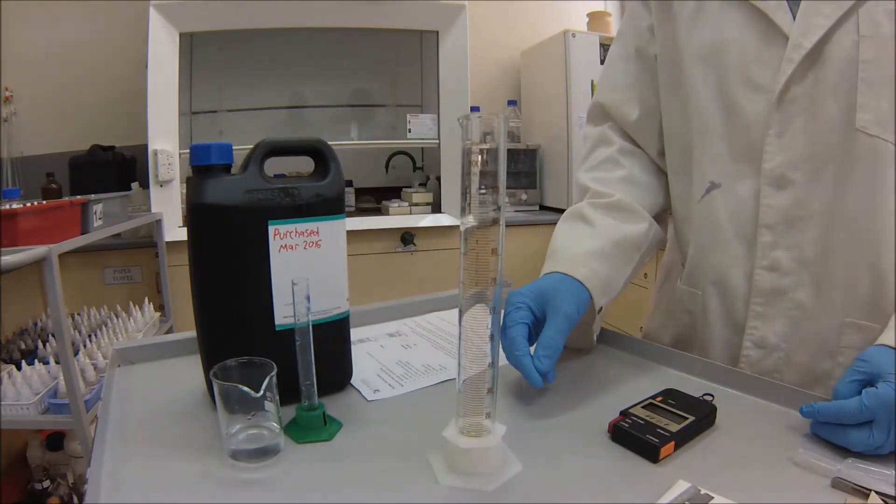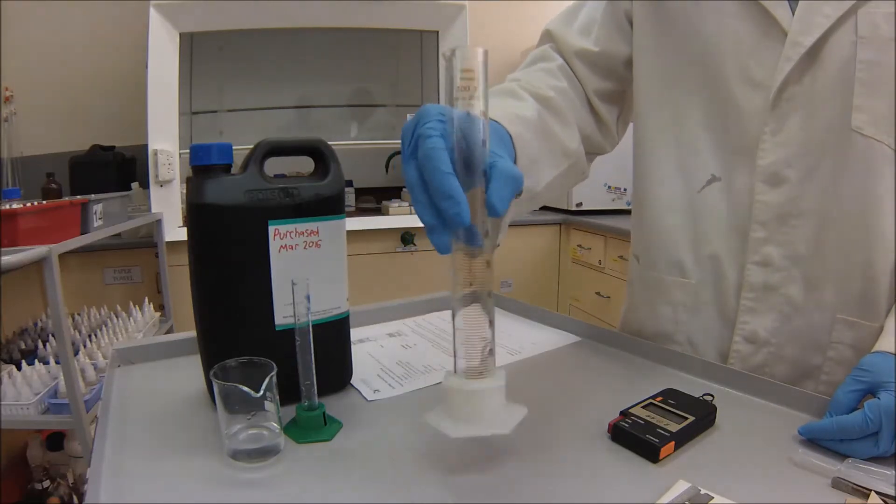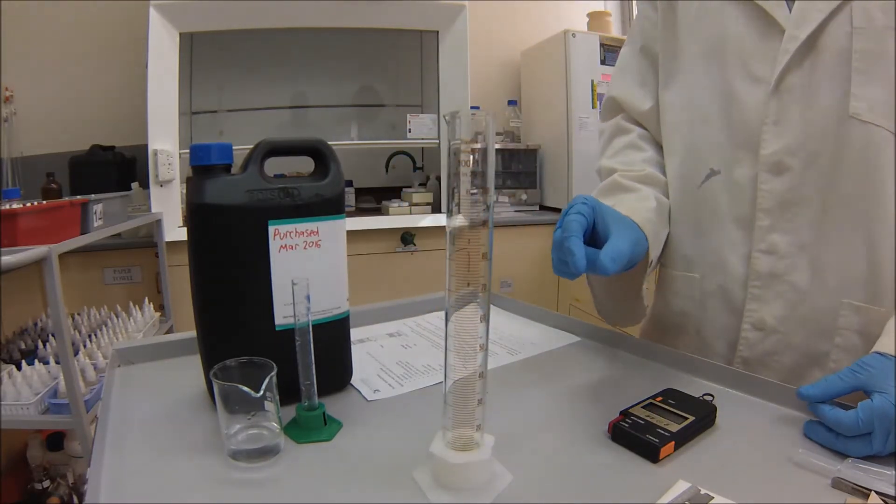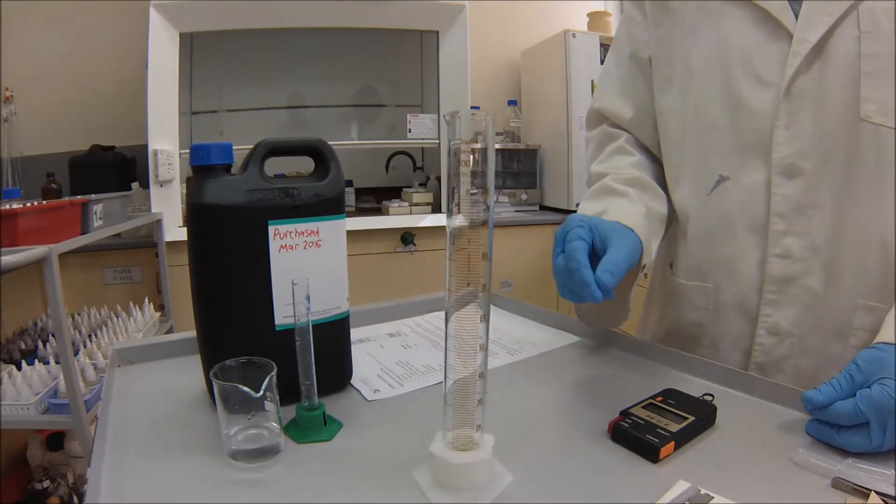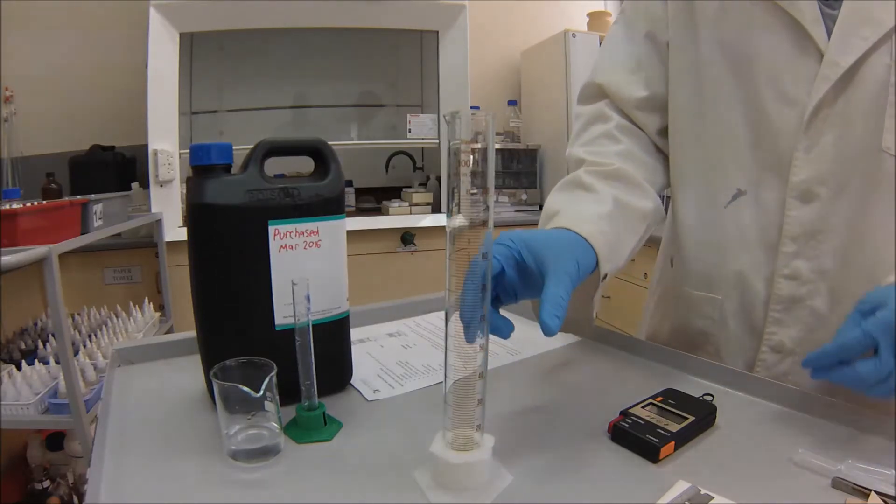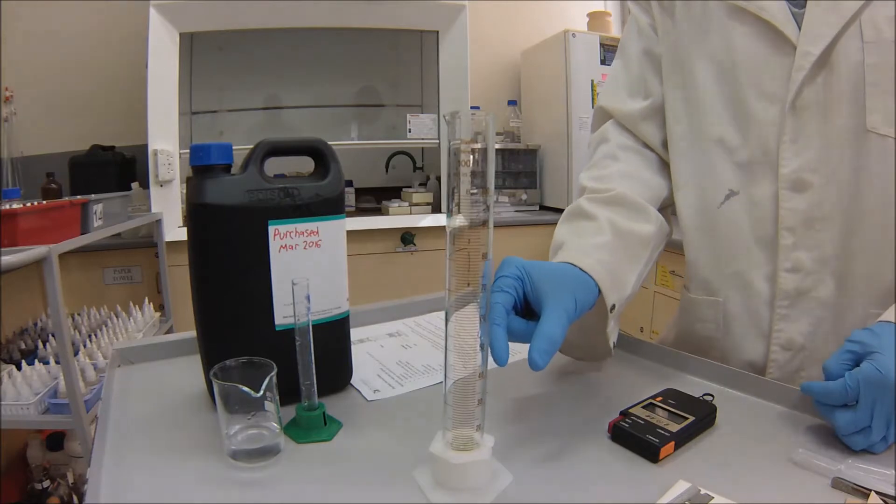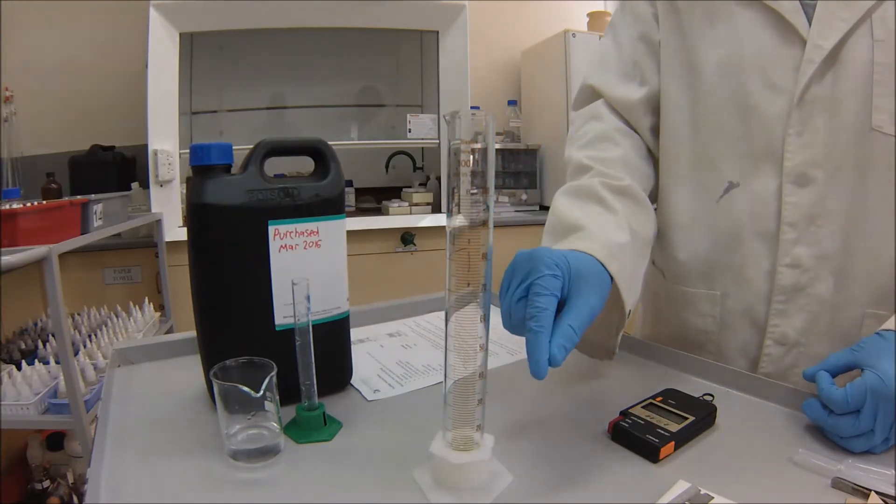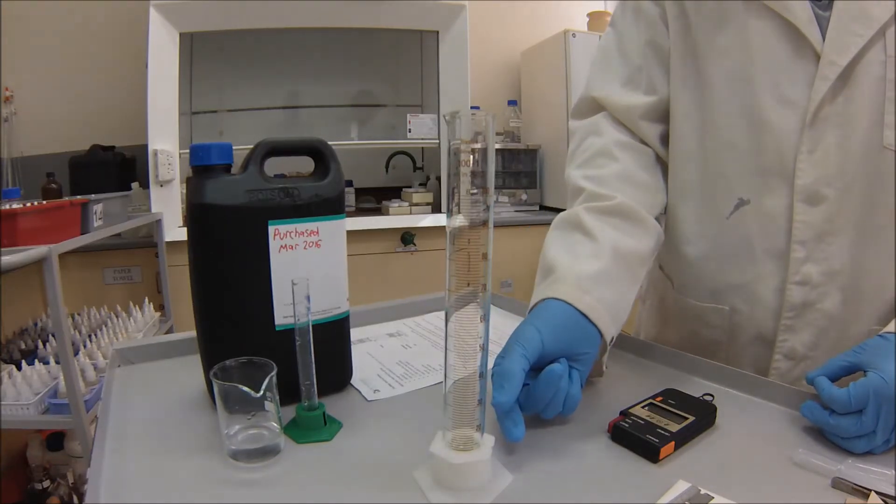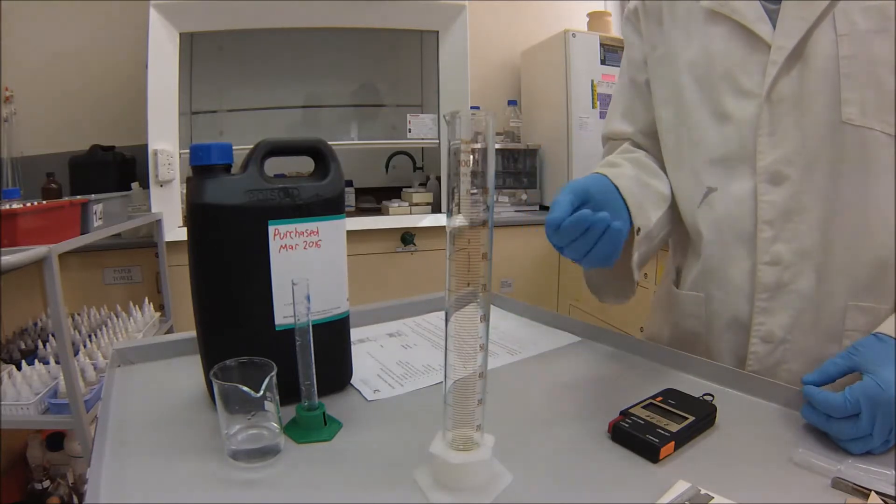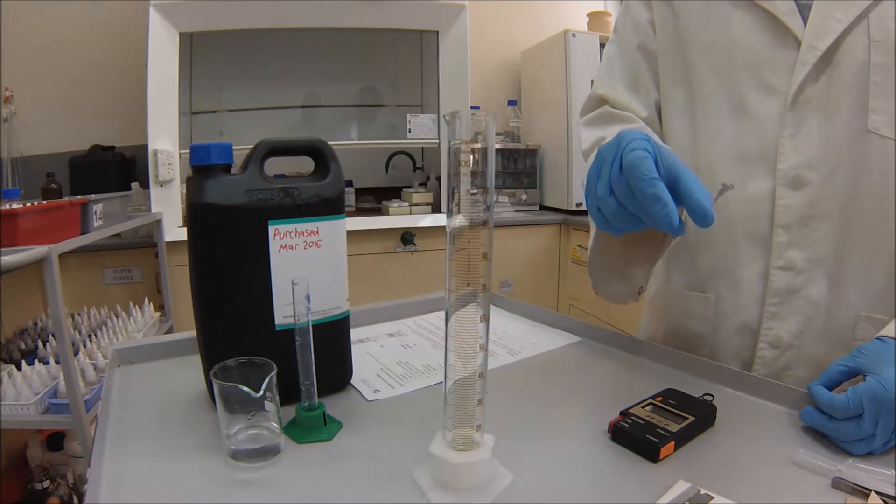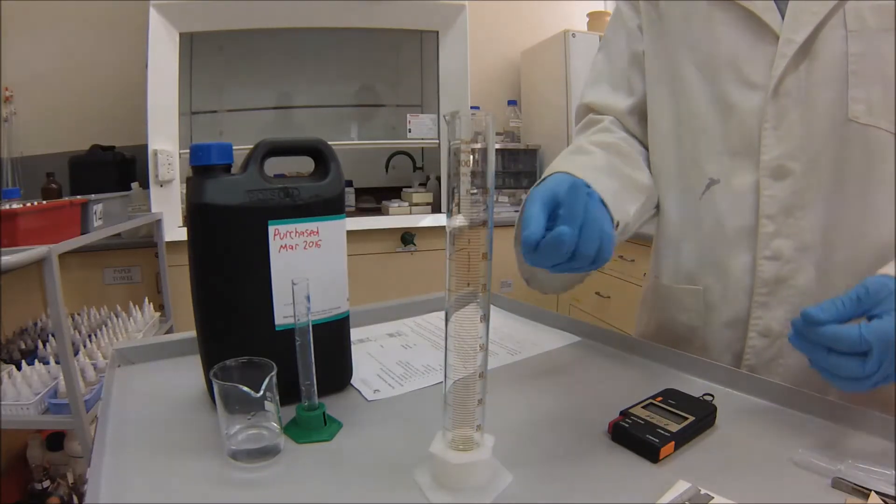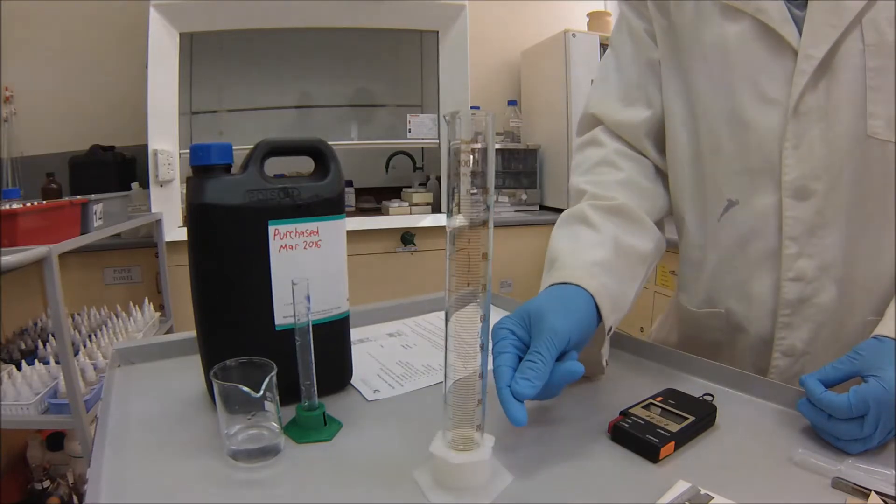And now we'll add our 9ml of hydrogen peroxide. OK, so now that we've got our hydrogen peroxide and we've also got our detergent in there, just swirl it around. You want to try and dissolve that detergent as much as you can into the hydrogen peroxide solution. OK, so now that we've done that, what we're going to do next is we're going to add our cube of liver into there. And as soon as we do that, we're going to start the timer. OK. Now, the important thing to remember here is that you want to know what the initial volume is, and then you want to look at the final volume. So you can actually determine what volume of gas has been produced from what final volume of bubbles you get. So it's important to look at the volume after you add the cube. The reason for that is because the cube of liver is going to displace some of that liquid, so it's going to change the level of the liquid that you'll have in the cylinder. Now, because of the cube, again, ideally if it's 1cm cubed, that would be 1ml of volume displaced, so it should go up to just over 10ml. But, of course, it's not going to be exact, so just to try and take that into account in terms of the volume, we'll look at that immediately afterwards.